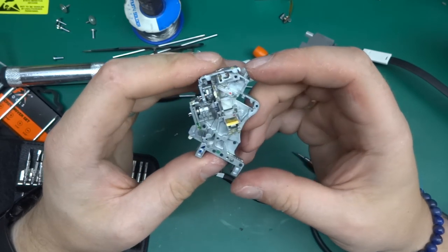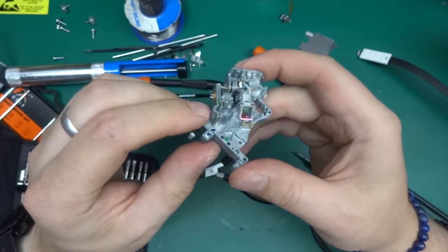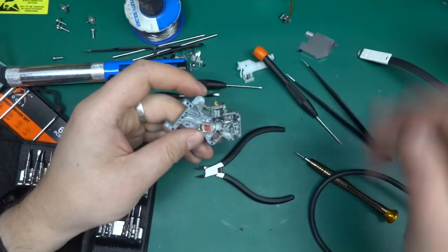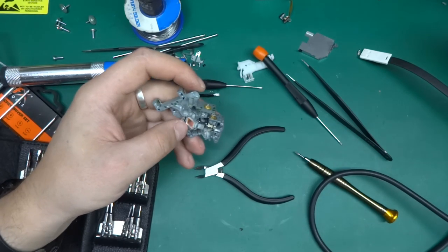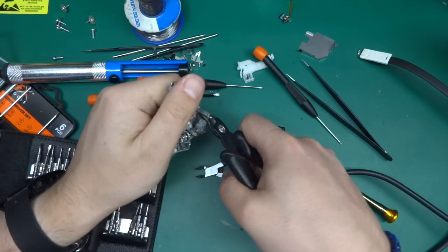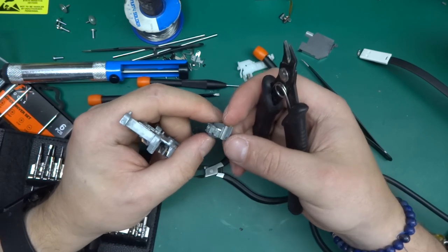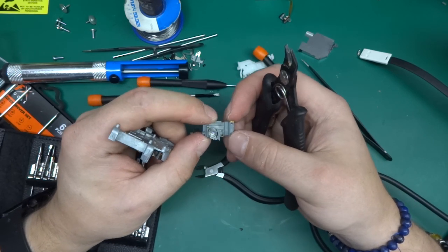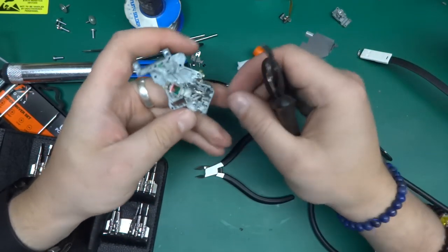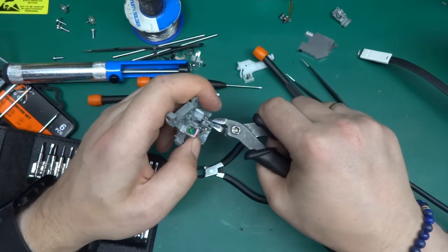Now, from what I see over here, the diodes are mounted in a piece of metal that's not the same part as the rest of the assembly. So in this case, what I'm going to attempt is to apply some force to the whole metal, and hopefully the glue will let go, just like this. And we've got a laser and a lens in front of it. So before I take it apart, I'll try to use it with the existing lens.